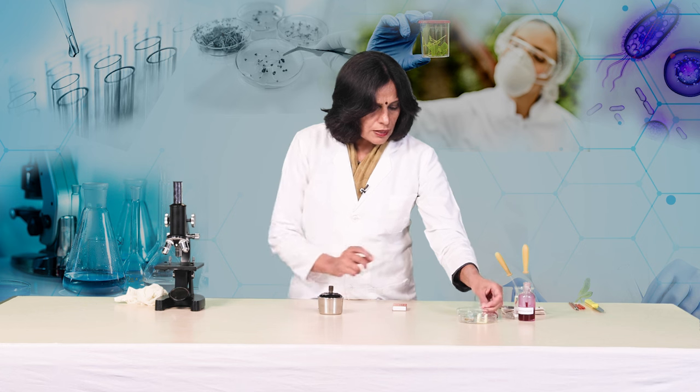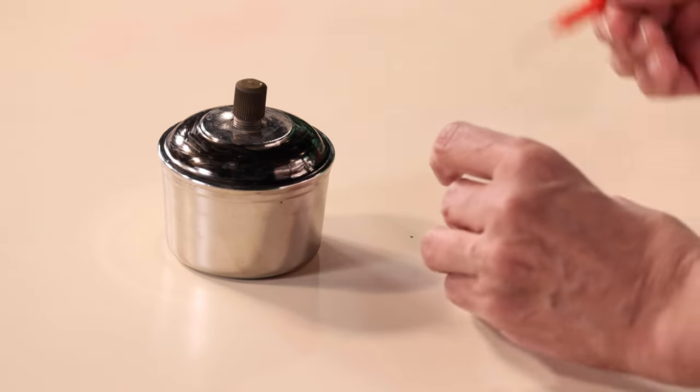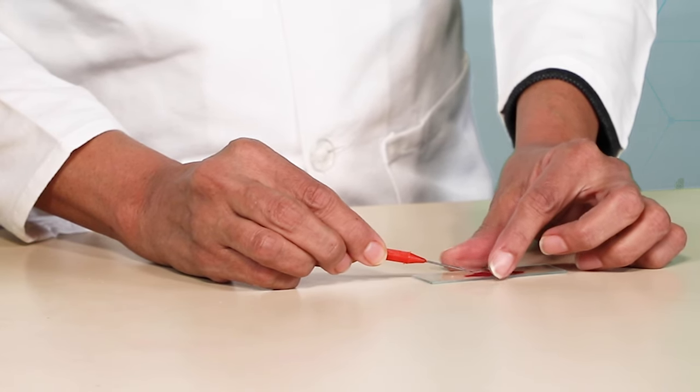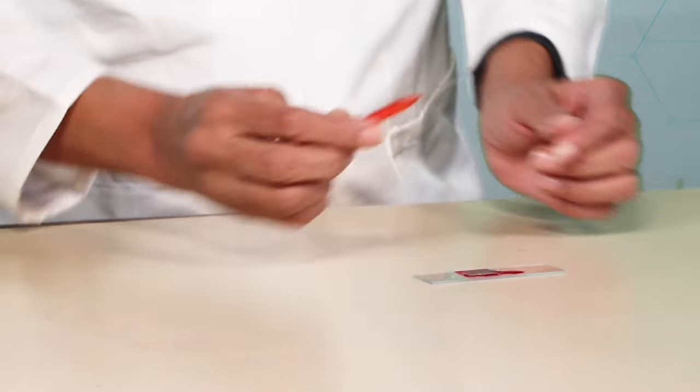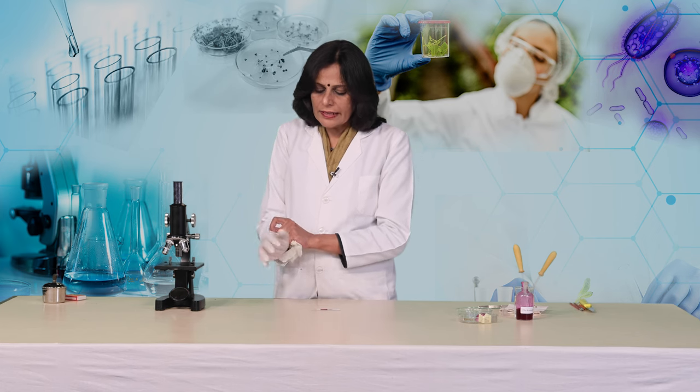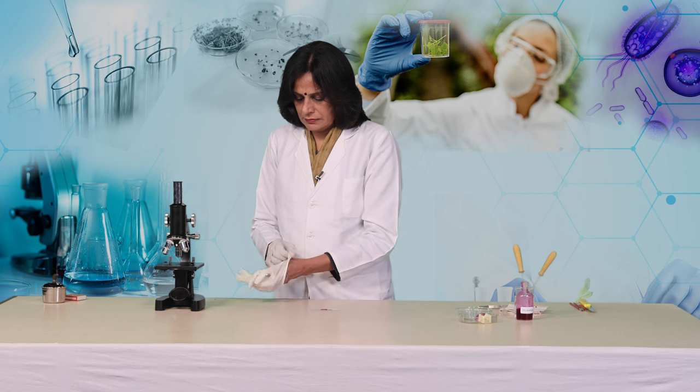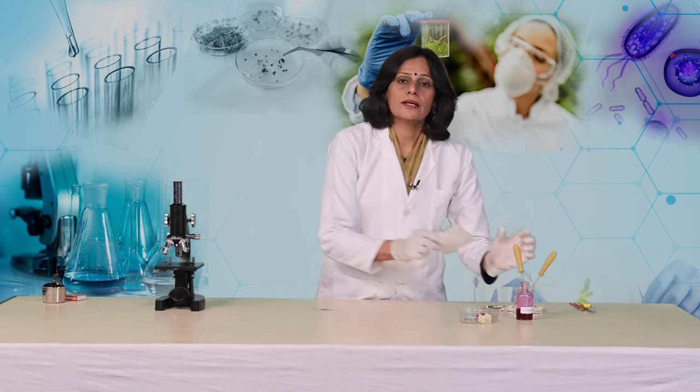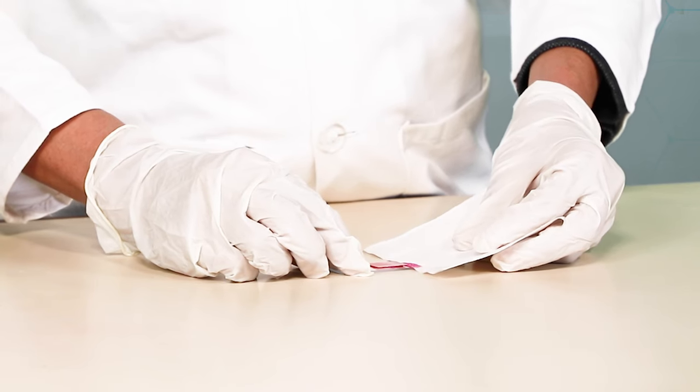We are going to lower down our cover slip very, very carefully and slowly with the help of the needle. I will wear the gloves again and I am going to remove the excess of the stain with the help of the blotting paper.